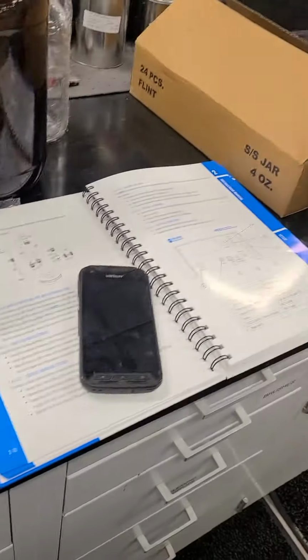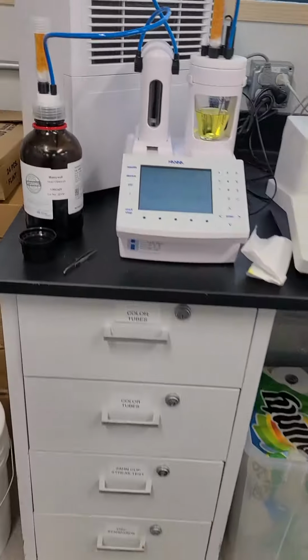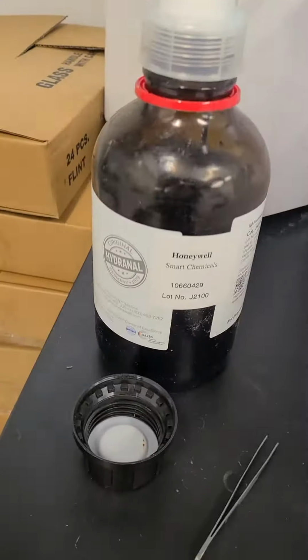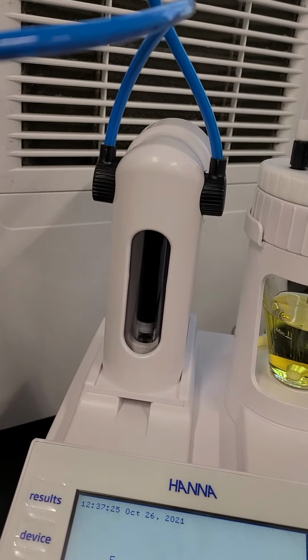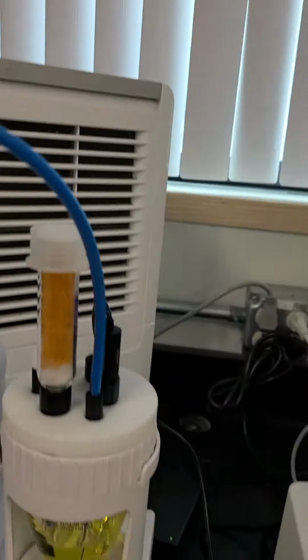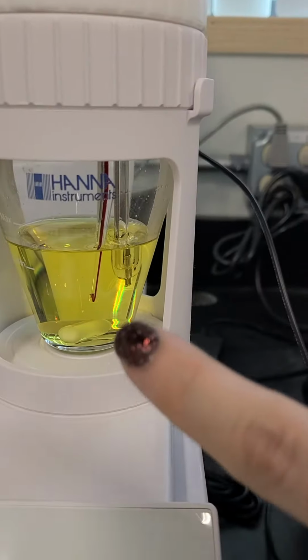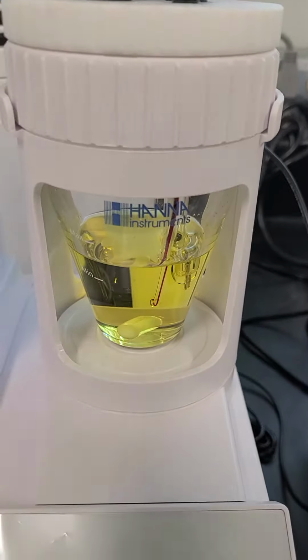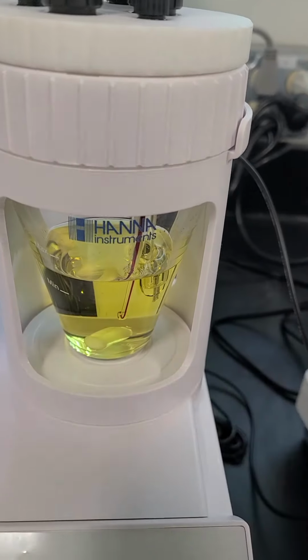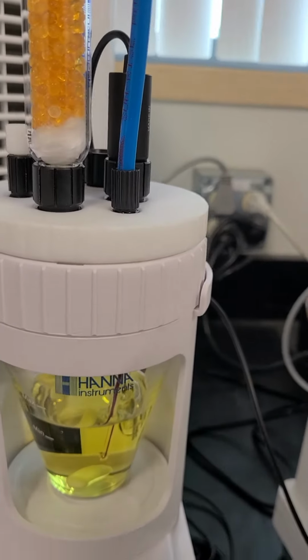So this is a new instrument we just got. I have our composite 5 going up into the pump, and then from the pump going into the dispensing tube. This part came pre-done with an O-ring and then the dispensing tube and then this tube screwing into it.